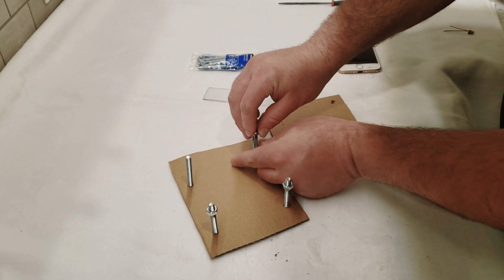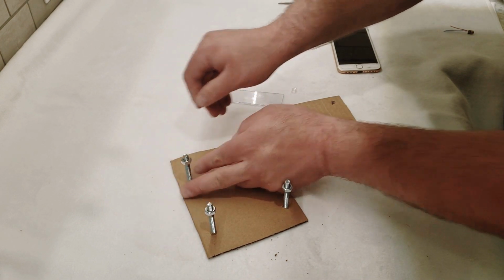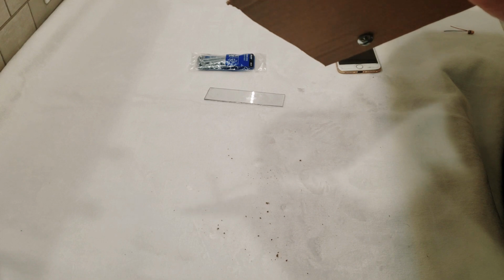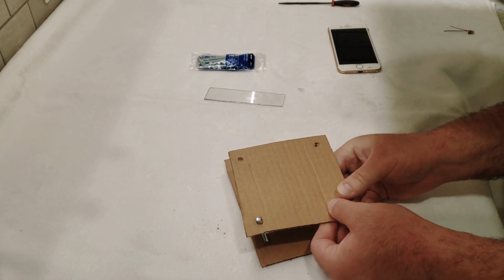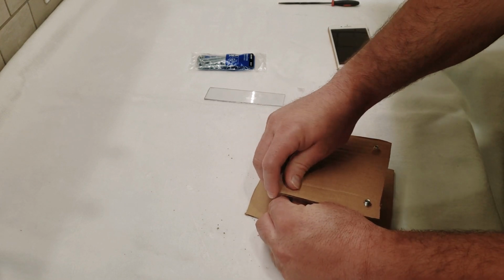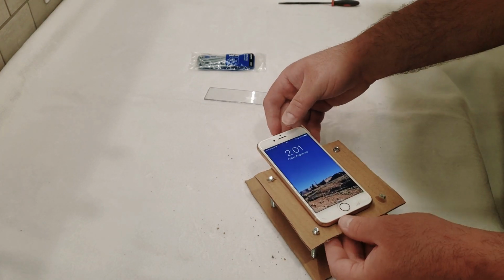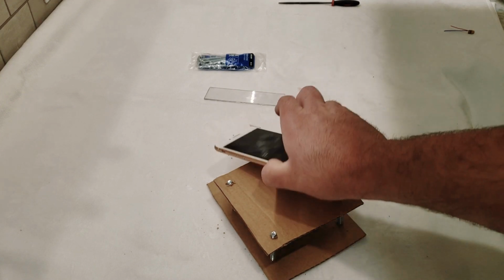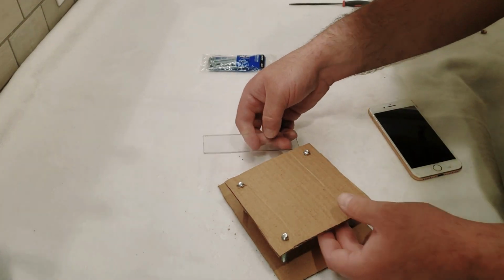So let's get them to about the same height on each one. Looks good. Okay, and then we're just going to set this piece of cardboard. Let's see if we can just push these holes through there. And then we have a pretty unstable but semi-stable platform that we can set our phone on top of. As you can see, it hangs off the edge so that the camera is actually off the edge right there. And now we are going to make the mounting plate for this.